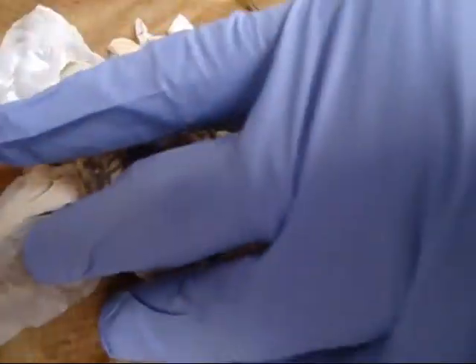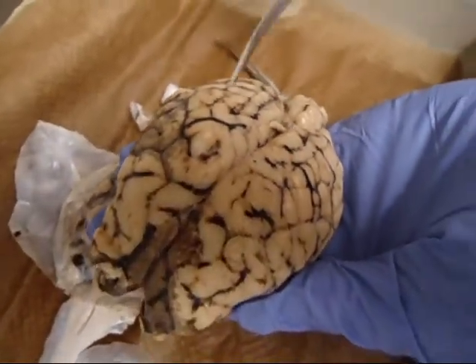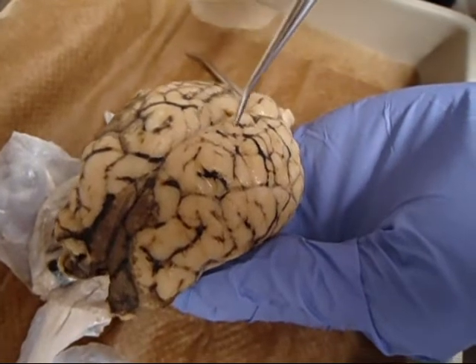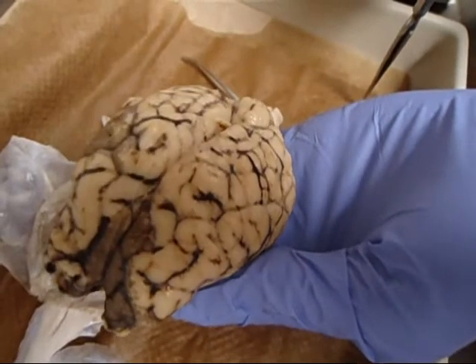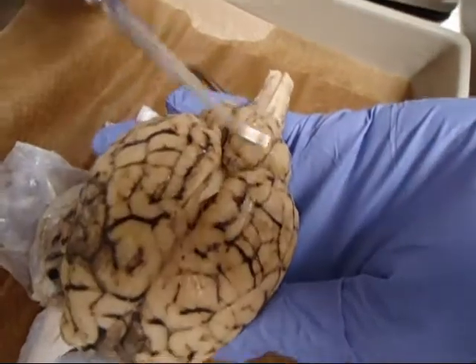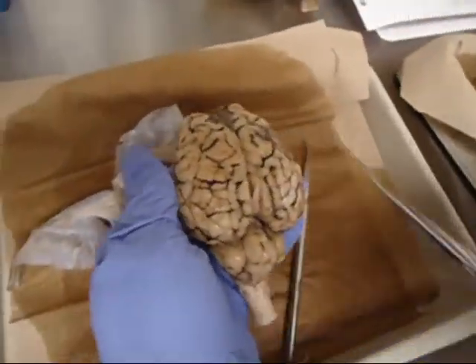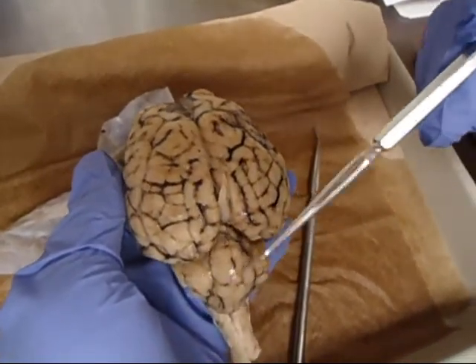When you flip over, the questions he might ask from the top of the brain are to name a bump or a lump. Any of these bumps or lumps would be known as gyrus. The actual slit or the groove between the gyrus is going to be the sulcus. And he'll ask general regions as far as the cerebrum, which is the big part of the brain, and the cerebellum, which is the little brain. And then he may ask which hemisphere, the right or the left. So you're going to want to know the cerebrum has two hemispheres, and the cerebellum is the little brain in the back.